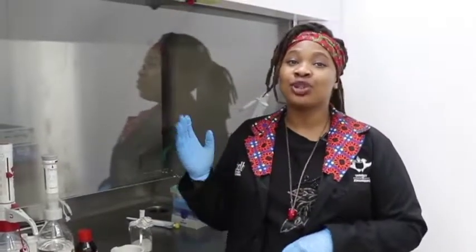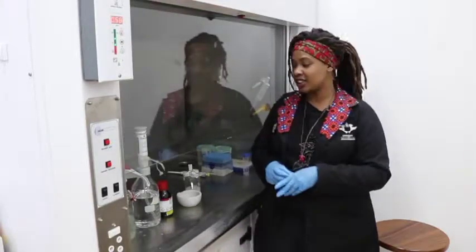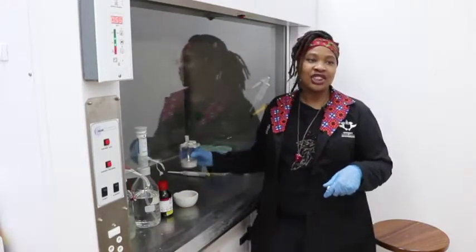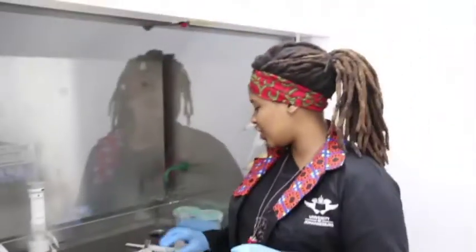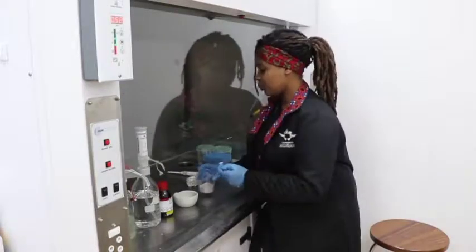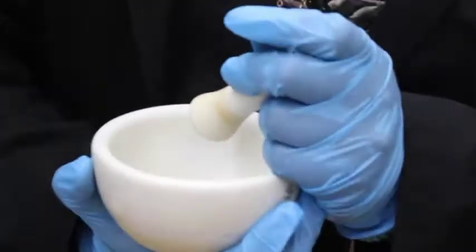The next process is done in a fume hood, which extracts all the harmful chemicals out through a vent so that you don't get the toxins. We have here an array of chemicals which we will use to lyse the material. First of all, we use silica powder — silica gel, the same thing you normally find in your shoes when buying a new pair, in that little square packet that says 'do not eat'. We use it like sand: take a little teaspoon of silica and pour it into your mortar and pestle, then begin the task of grinding the material until it is a fine powder.